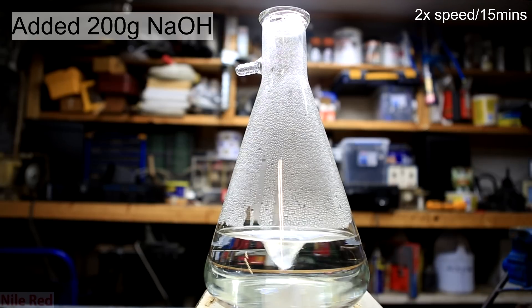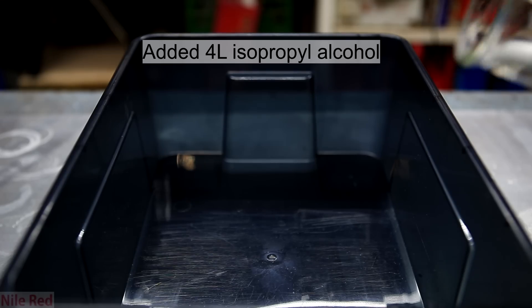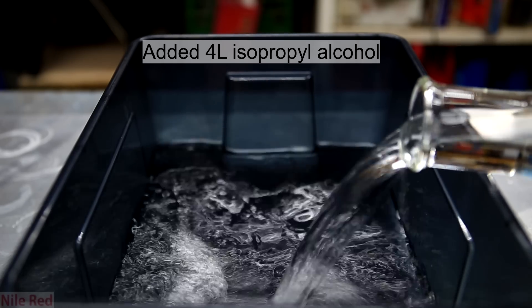Because cooling takes a little while I prepared the bin with the alcohol in the meantime. So to a suitably large plastic bin was added four liters of 99% isopropyl alcohol.